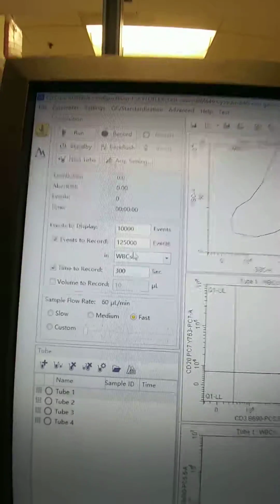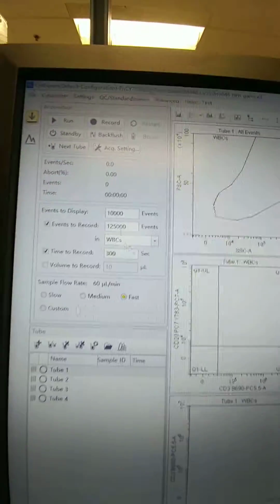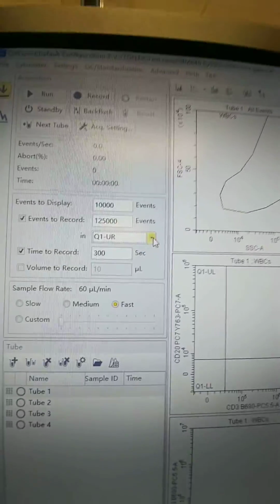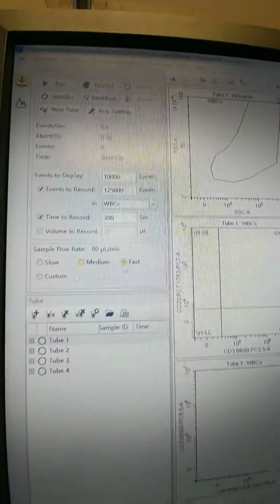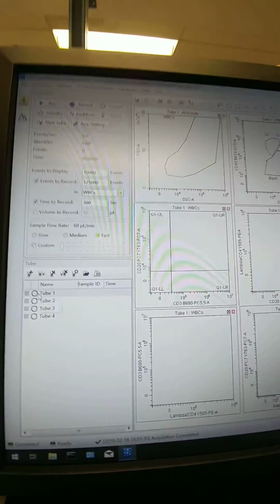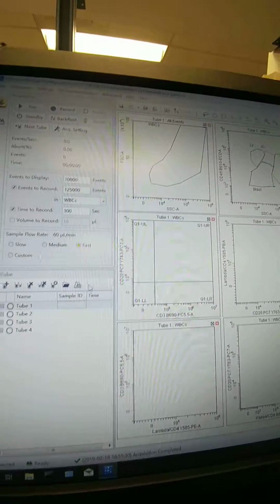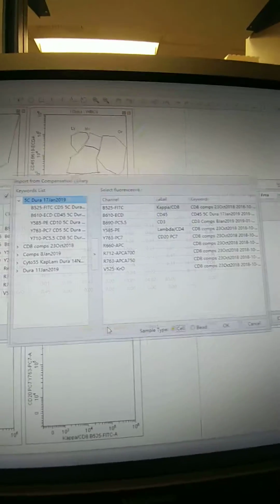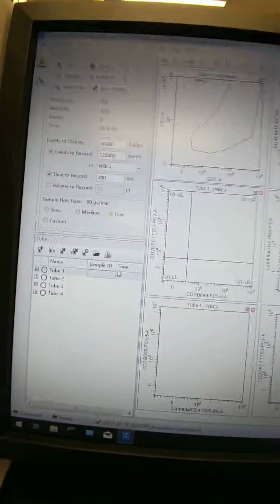Okay, so what I want to do now, before I run it, to make sure I don't forget anything, and this would be true too if you ever wanted to change events to record and which gate to look at on a permanent basis. After you've loaded a new one, before you start running data, go ahead and make your changes. Change this here, change the collection gate here if you want, your sample flow rate, whatever you want. If you wanted to change comps, you could click here, the comp matrix, and pick whichever one. You could import from library, pick the comps that you want. I don't want to change comps on this one, so I'll leave them there.